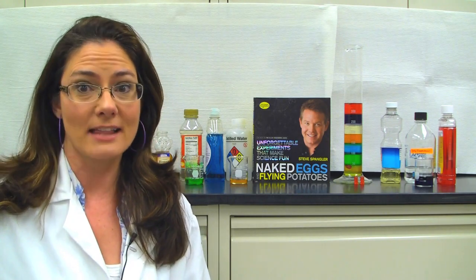Several videos back I determined the average weight of gummy bears, and then I was also working on trying to determine the average volume of a gummy bear by measuring 3 dimensions and calculating. That is not the best way to determine the volume of an object that's an irregular shape. There's a much better way to do that, so let's take a look at that now.